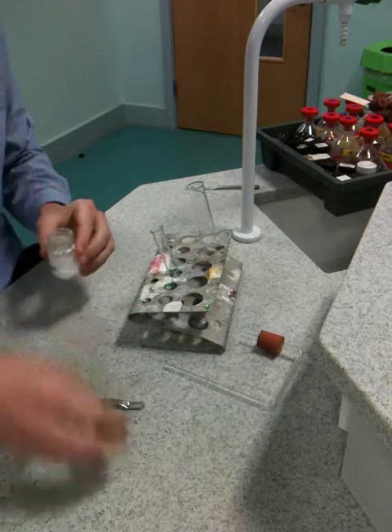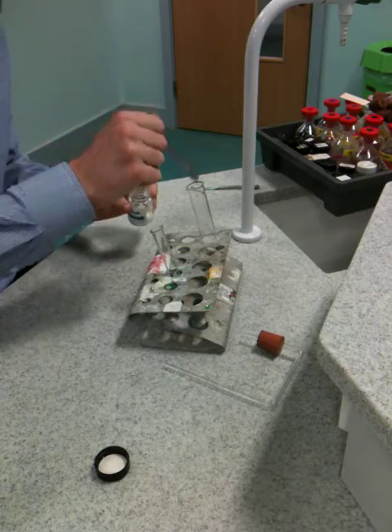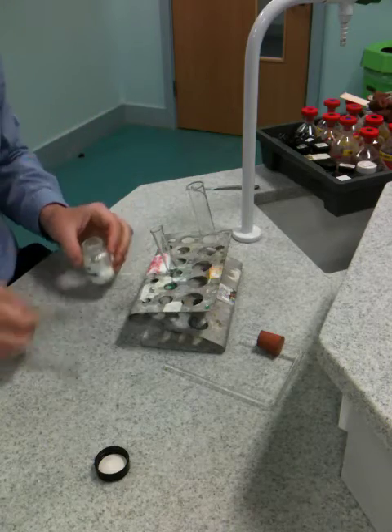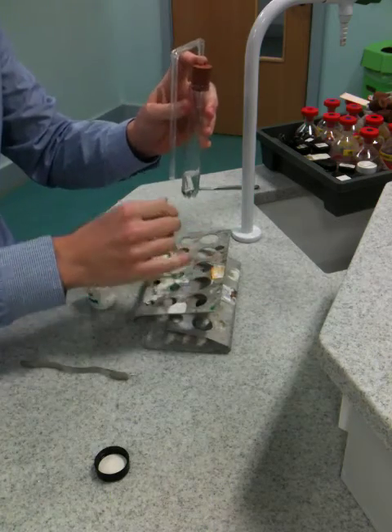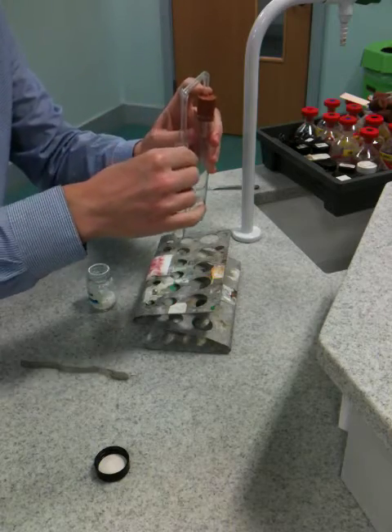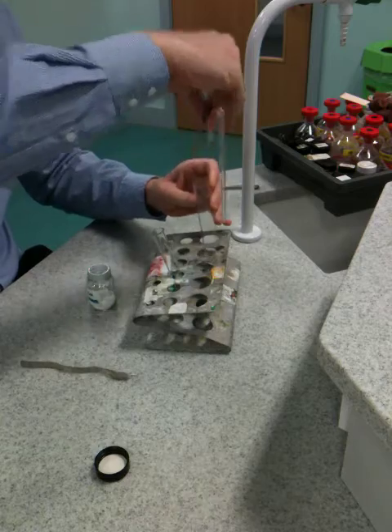The next part we've got to do fairly quickly, so you need two people on this. One person is going to be in charge of the calcium carbonate — they're going to put a big generous spatula of it into the hydrochloric acid, and straight away person number two has to put the bung into the top of the boiling tube and the delivery tube into the lime water. You've got to be quick.